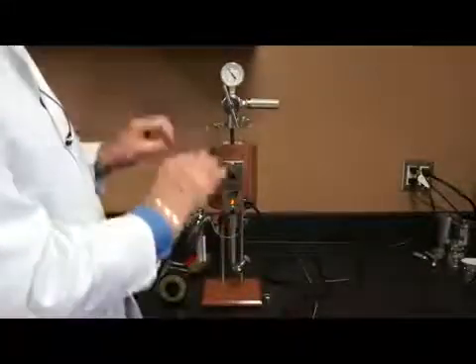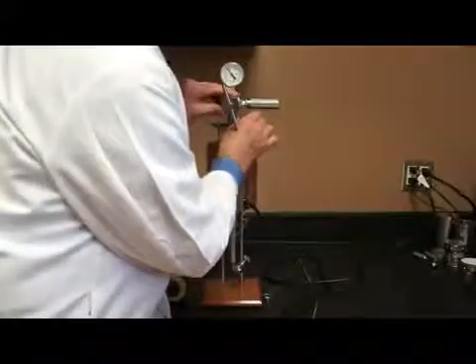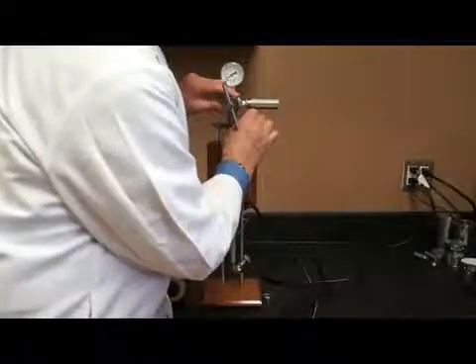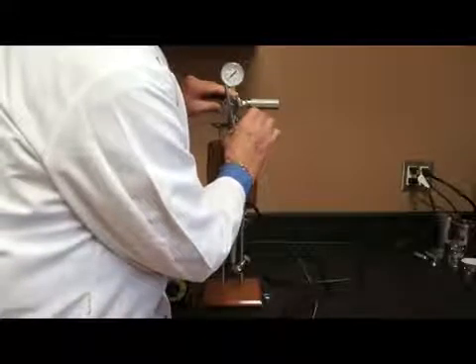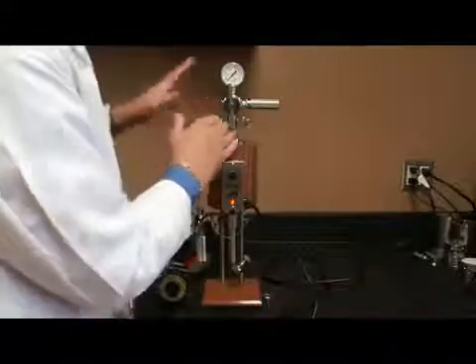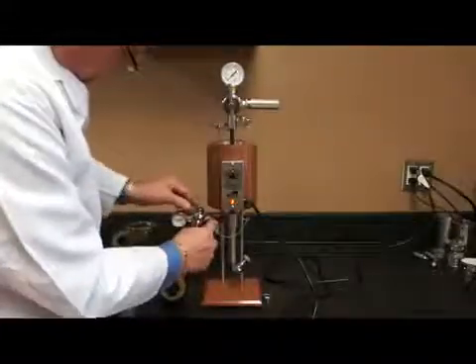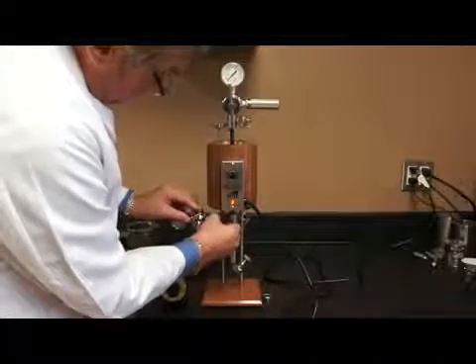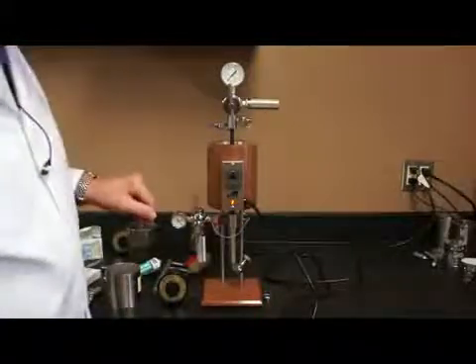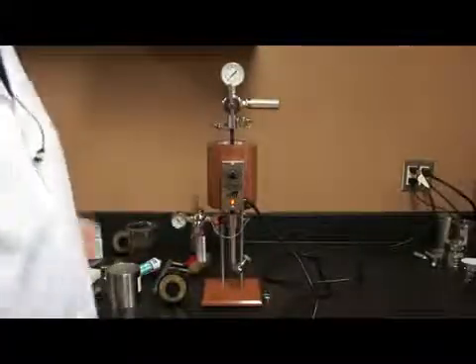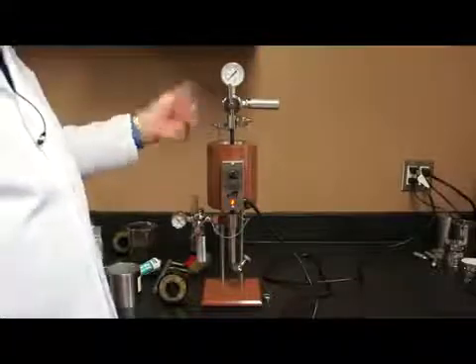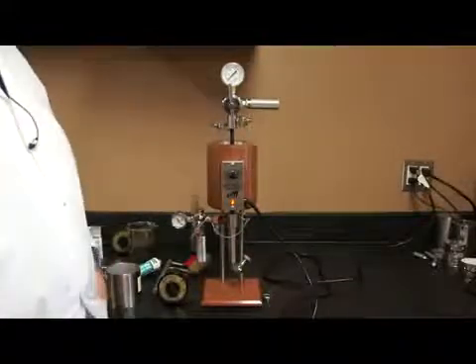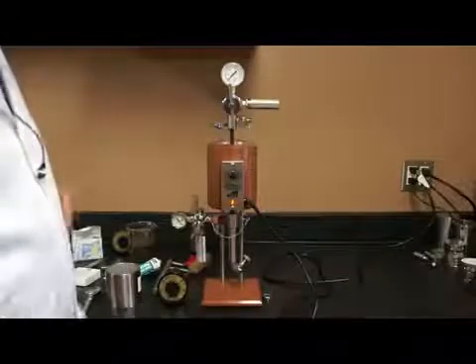It bleeds off the pressure, but additionally, they're safety features and don't allow too much pressure to be put into the assembly. So I'm going to bleed off the pressure. You see the gauge go down to zero. So now I have no pressure going in here at all. I'm going to do the same thing on the outlet side. I want to be careful not to burn myself because this is hot. I will bleed off the pressure there. So both of these assemblies now, there's no pressure going into my valve stem assembly. I can now remove the pressuring assemblies from the top and the bottom.